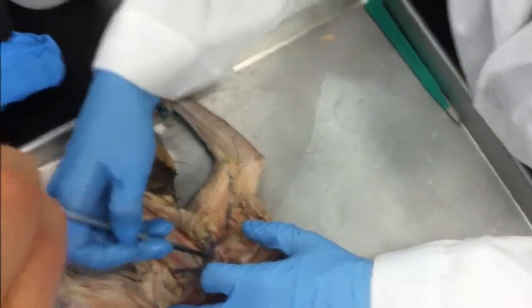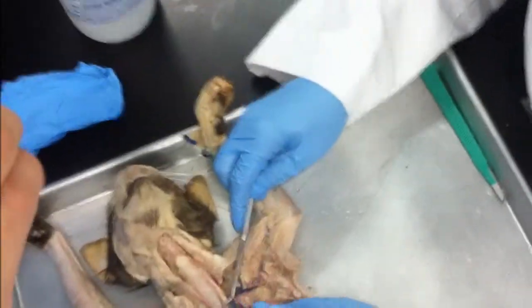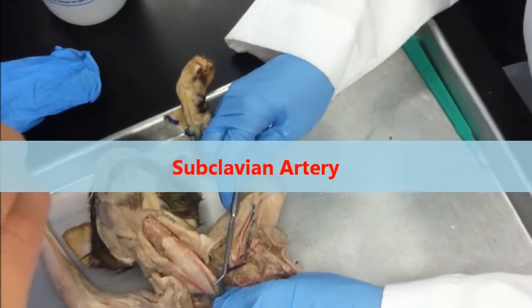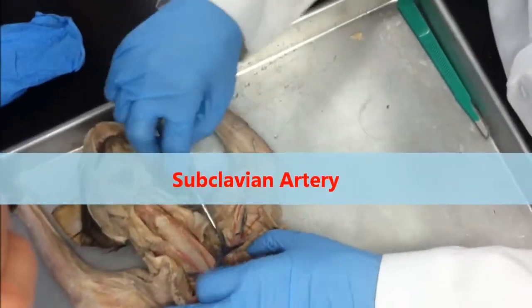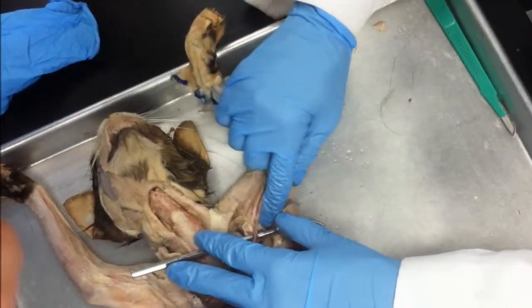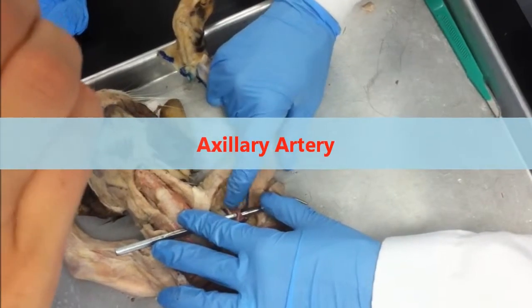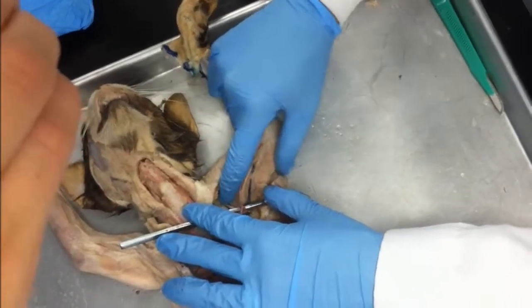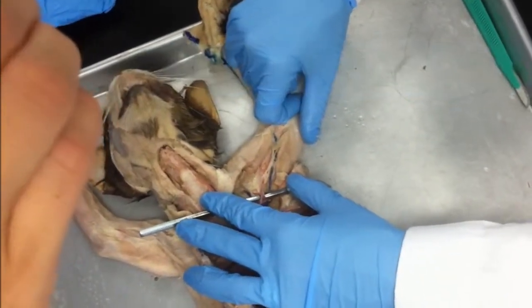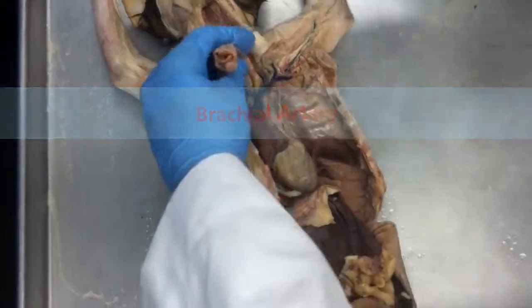Out from that, okay, this is going to go behind my clavicle. My first split past my internal mammary, going to my clavicle. That makes it the subclavian artery. Past that split, I've got the same split as my vein. I'm going to split deep into the arm. What is this split called? Axillary. Okay? Deep goes to subscapular, out goes to brachial artery. Okay? That's the top half of vessels.